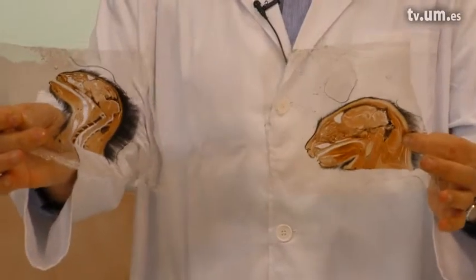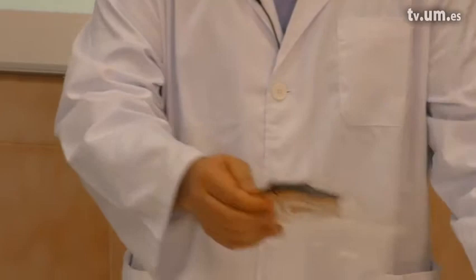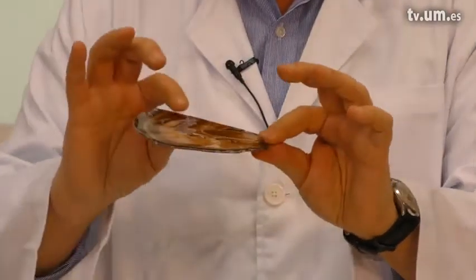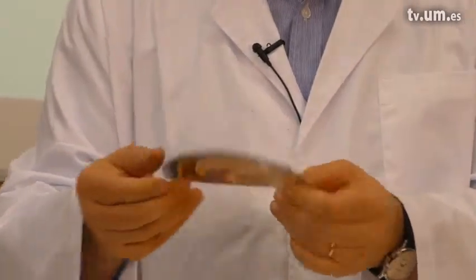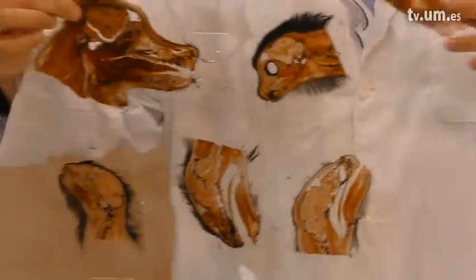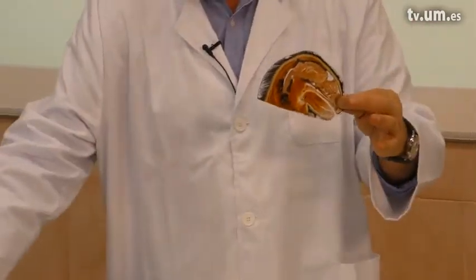We cut out the desired slices, and in the end, after peeling apart the foils and cutting around the slice, we get the final product. The final product is very thin, and on the bottom and top side of our slice we won't have any air bubbles. Just remember how it looked before — it looked bad with a lot of air bubbles in between, but no air bubbles on the surface of our specimen.